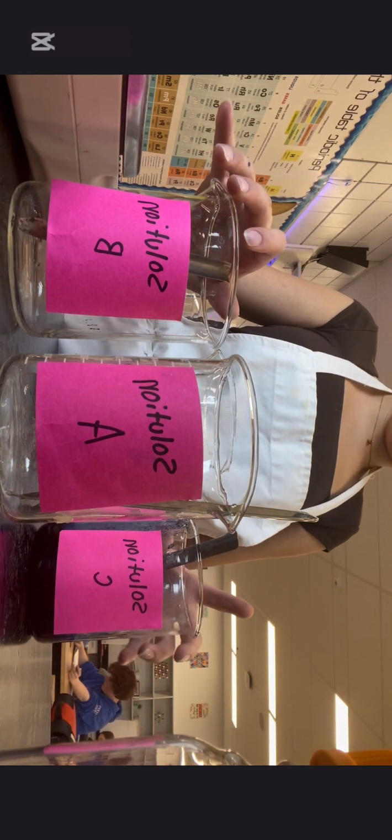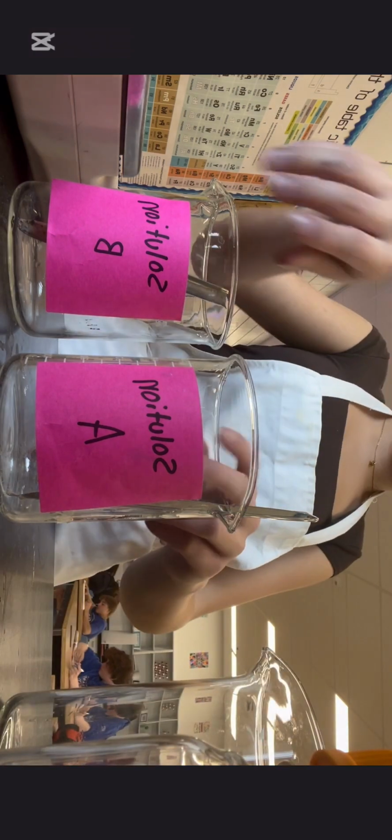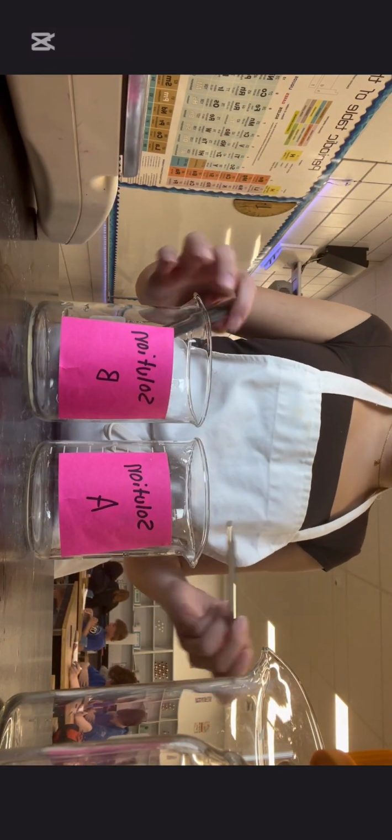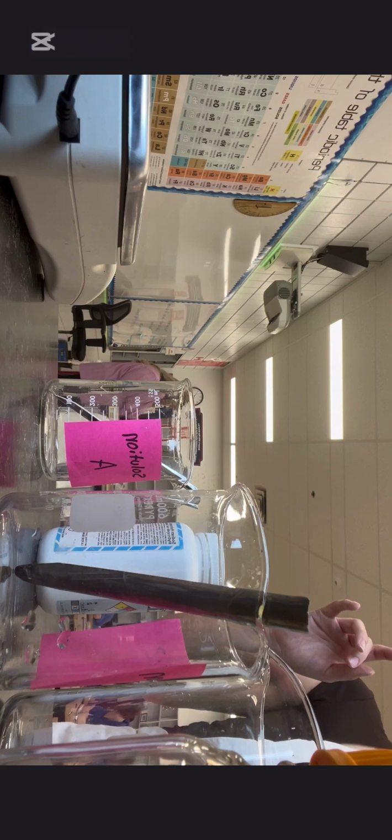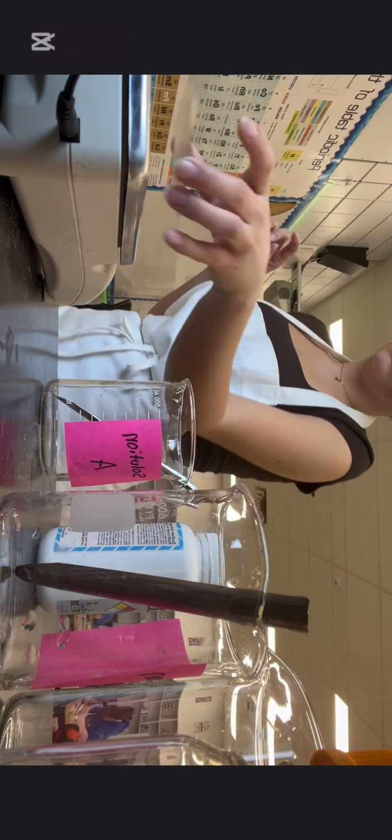And then I began to make the solution again because I wanted to see if I made it the same way, just putting less of our indicator in, to see if it would come out a lighter color and not as deep. So I began to make the solution all over again with the same measurements of solution A and B, and just added less of our indicator.